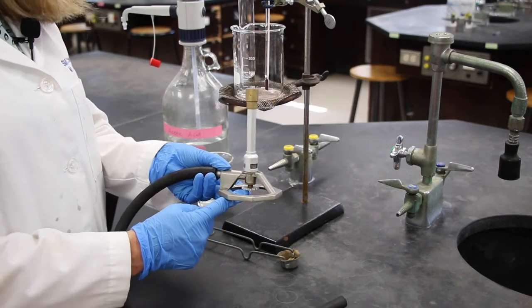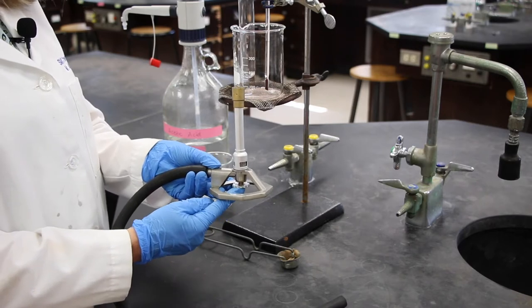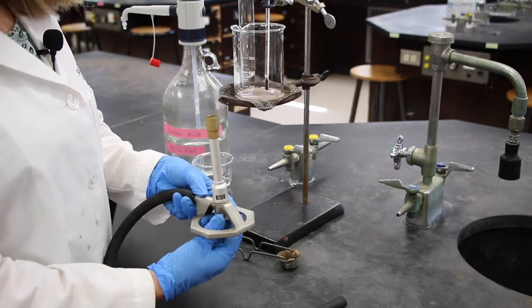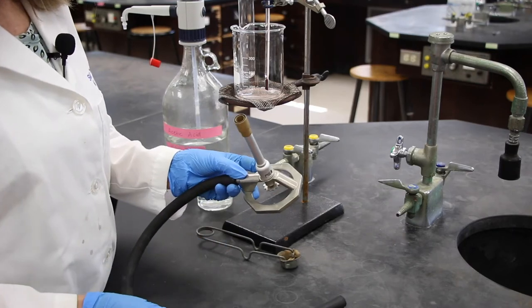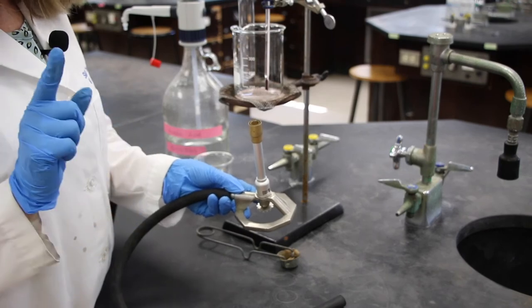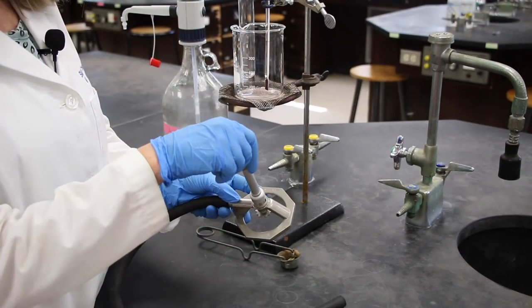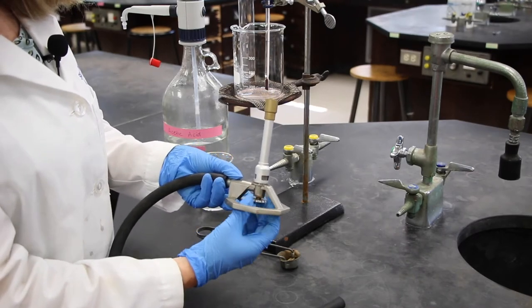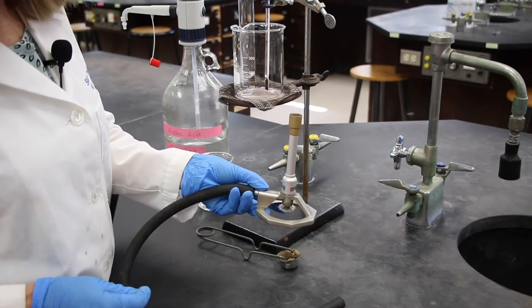Now, with the gas flow, this is opposite because it's a flammable substance. We will be turning that left, and we've shut everything off. Now we want to open both the air one full turn and the gas one full turn.